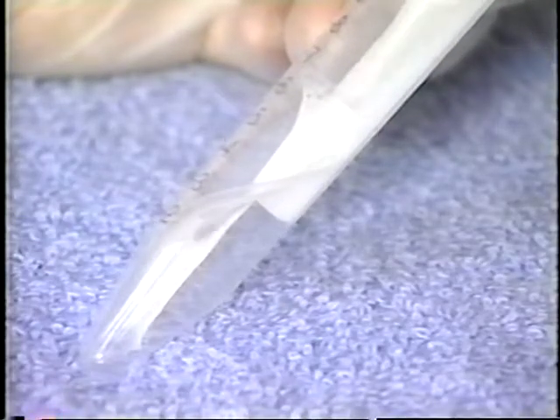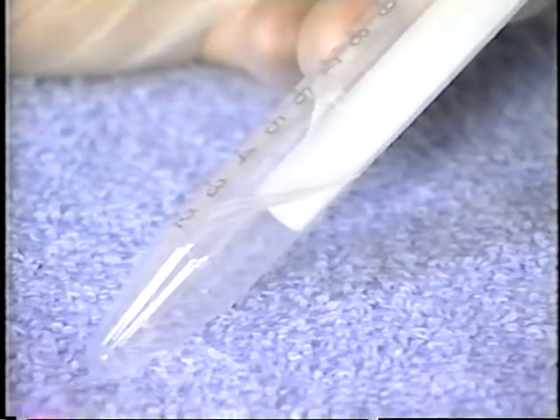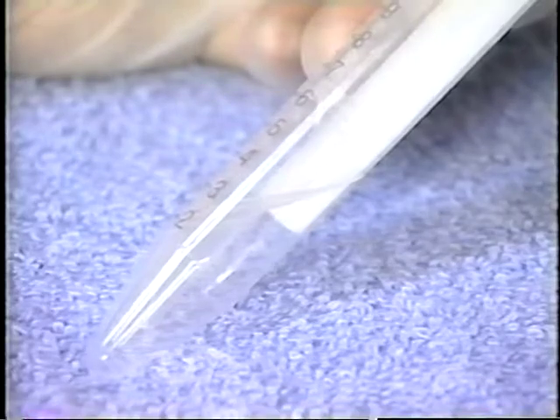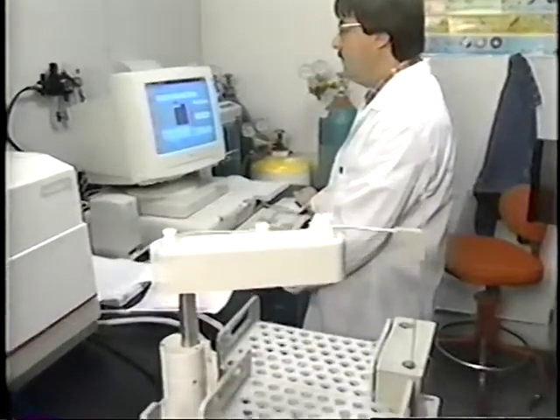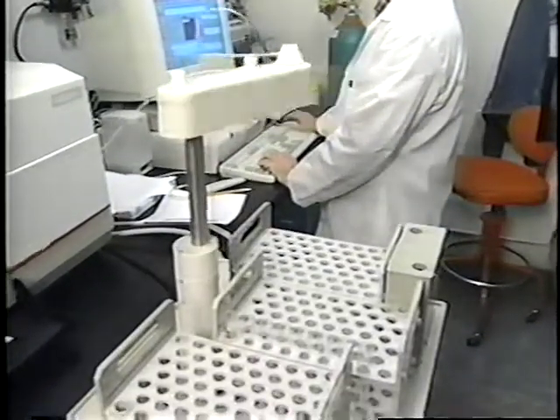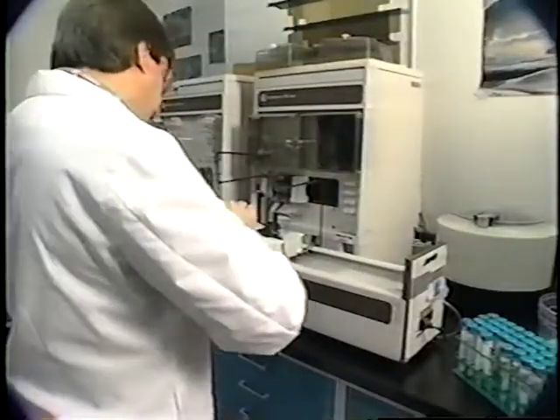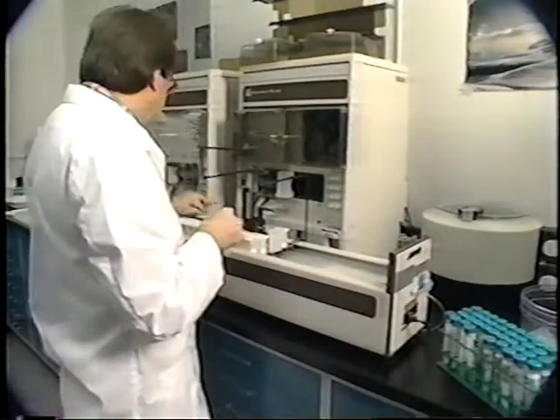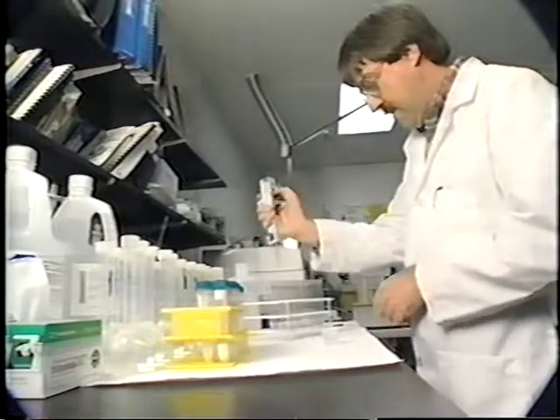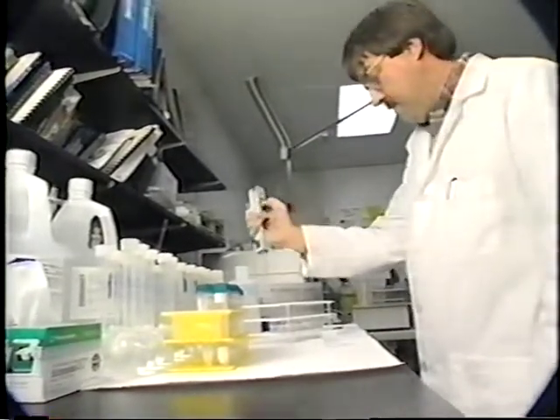The major sampling requirement for analysis of water-soluble species is that the filter material is hydrophilic, allowing water to penetrate the filter. These ion analysis methods include atomic absorption spectrophotometry, or AAS, ion chromatography, or IC, and automated colorimetry, or AC. AAS has been very useful for measuring water-soluble potassium and sodium. Simple ions such as magnesium and calcium can also be quantified by AAS.